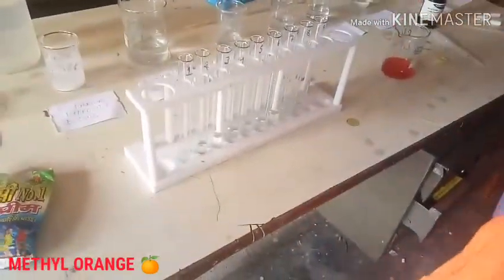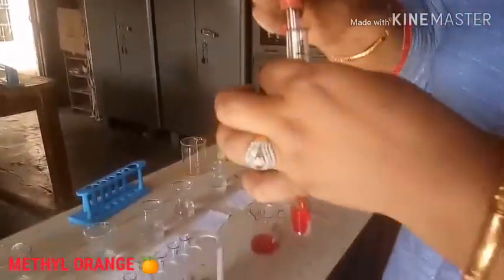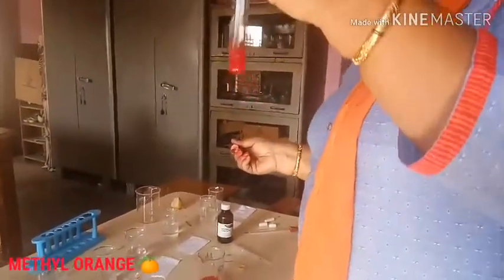Our third sample is lime juice. I took it out and put some Methyl Orange. It has changed to a very vibrant red color — from orange to red.